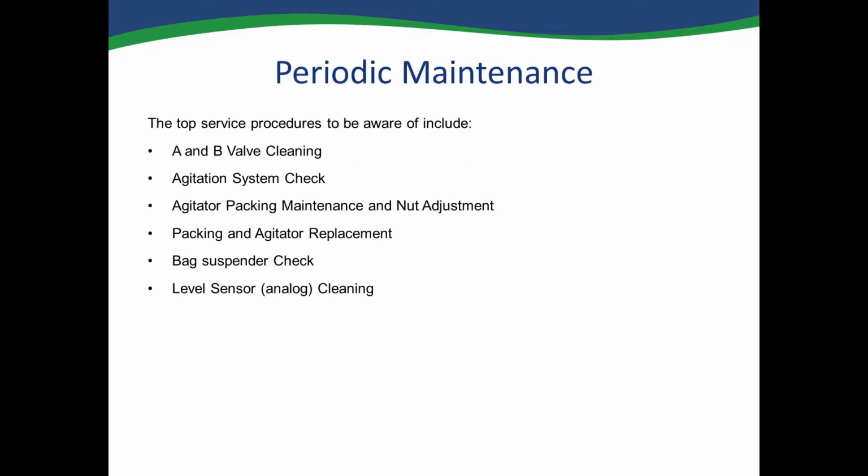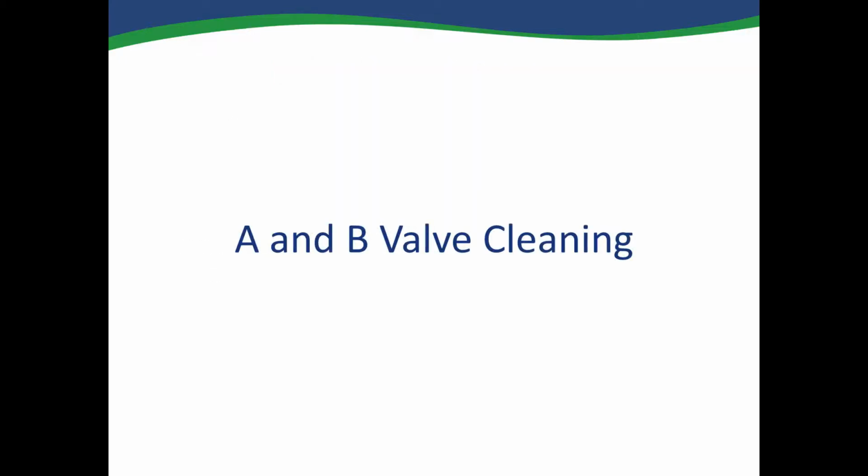We're going to start now by going through our periodic maintenance and the top service procedures to be aware of on the A2000 and show you short videos of each procedure found on our website. We're going to start with the A and B valve cleaning, which is necessary on the A2000 weekly or daily depending on the use. If the valves aren't cleaned properly, the instrument will not allow the chemicals to flow into the vessel, causing instrument faults. We can start by showing you the video for the A and B valve cleaning.